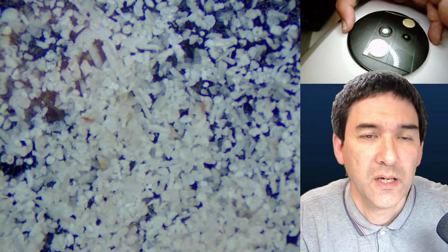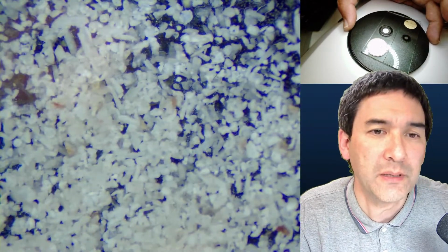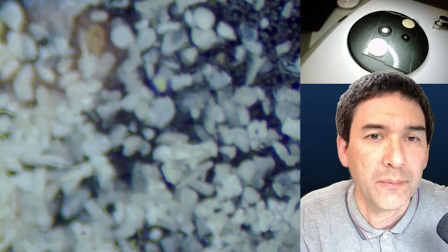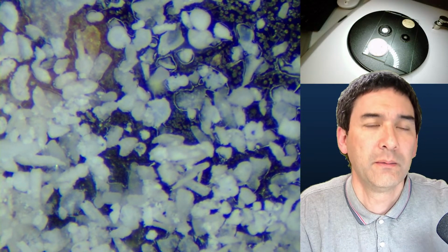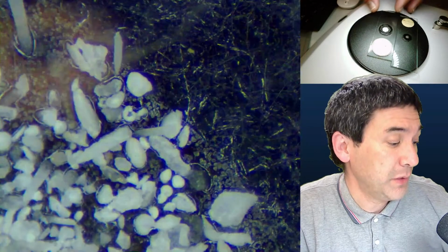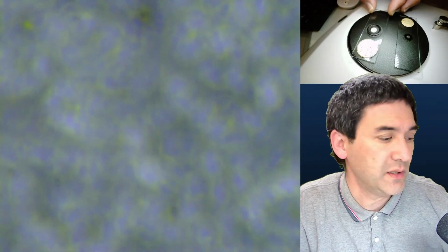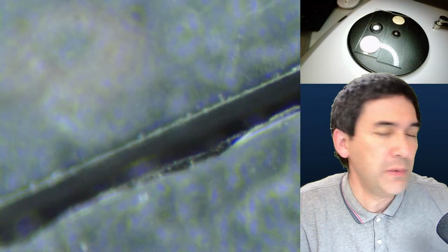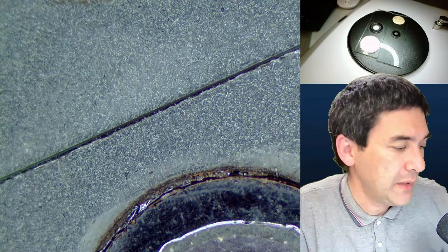Yeah. So again, these are also supposed to be forams, but you have to look very carefully to be able to find those structures, and I did not find a lot of them. Okay, but yeah, this is actually a fairly cheap camera compared to others, and it's an industrial camera. If you're interested in the technology behind the whole thing and how I set it up, I am currently preparing a little review for my other channel where I explain to you how I set it up. Yeah. So, what time is it?